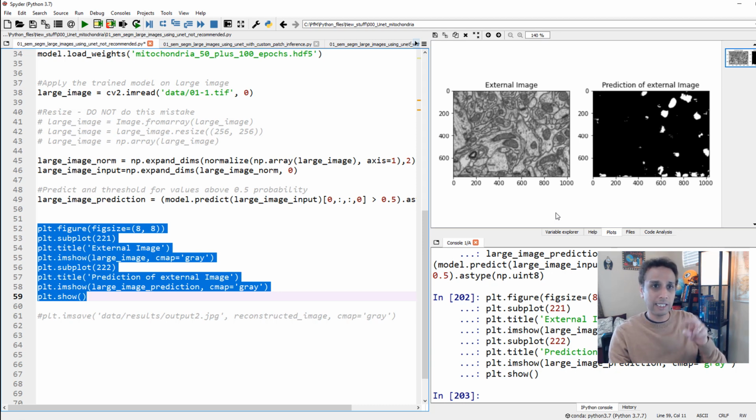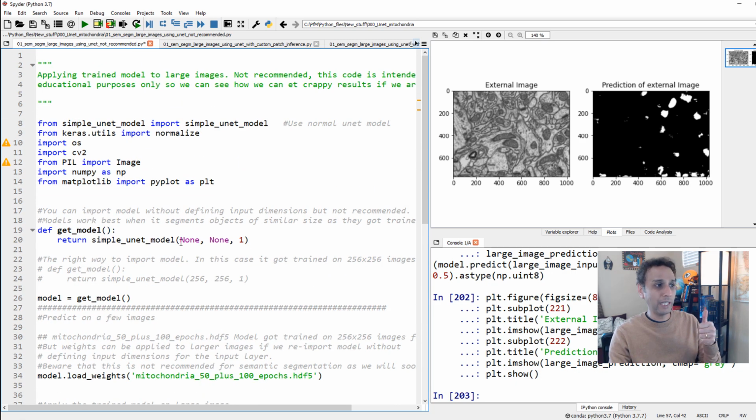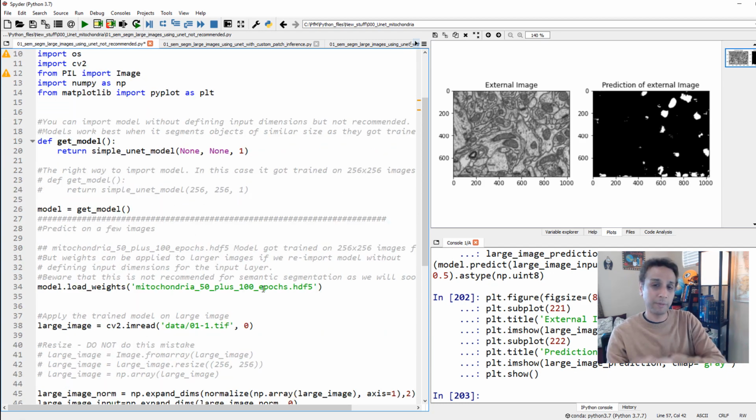Even though technically it's allowing you to do this, this will yield horrible results, so don't do this, okay? Lesson number 1, do not... for training, this is fine. You get this model, now you train on larger images and then apply the model onto your larger images, that's fine. But make sure that the image you're trying to segment and the images it got trained on are of similar dimensions. Otherwise, it learns based on features at a certain pixel size, and now you're applying it at a different pixel size. So this doesn't work.